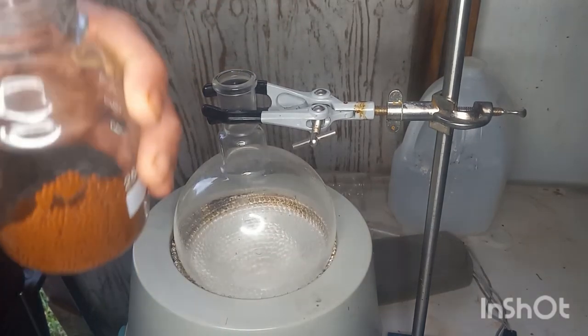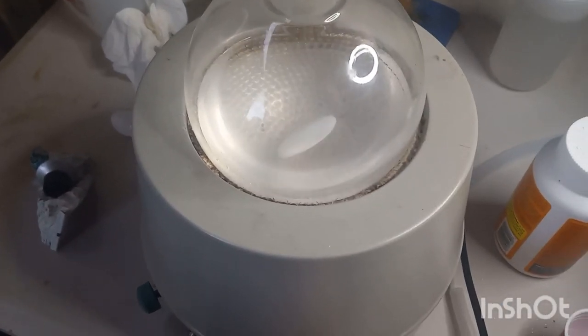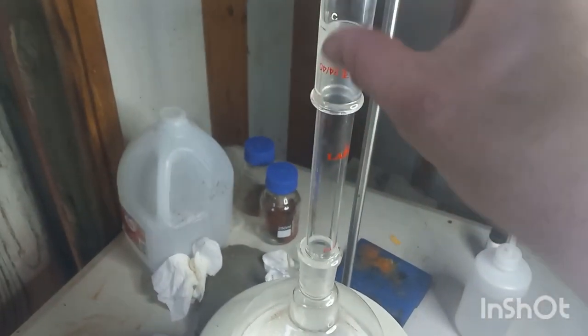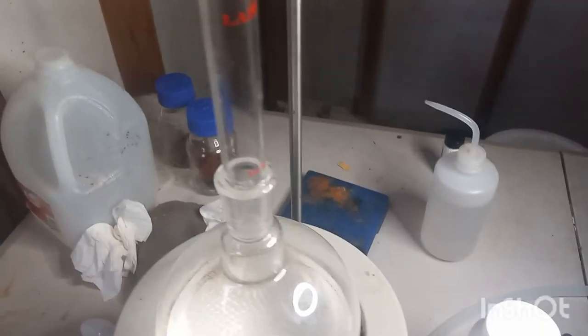We'll add this up and I'll get the rest in. Cool. So we have our unfortunate little molecular sieves in there. Poor things aren't going to be good for long. And we have this double-sided adapter stacked to make a makeshift Vigreux column, I think. Correct me if I'm wrong, I'm going off memory and lack of sleep. So we're going to go up here. Got our condenser and a drying tube with some magnesium sulfate in it.